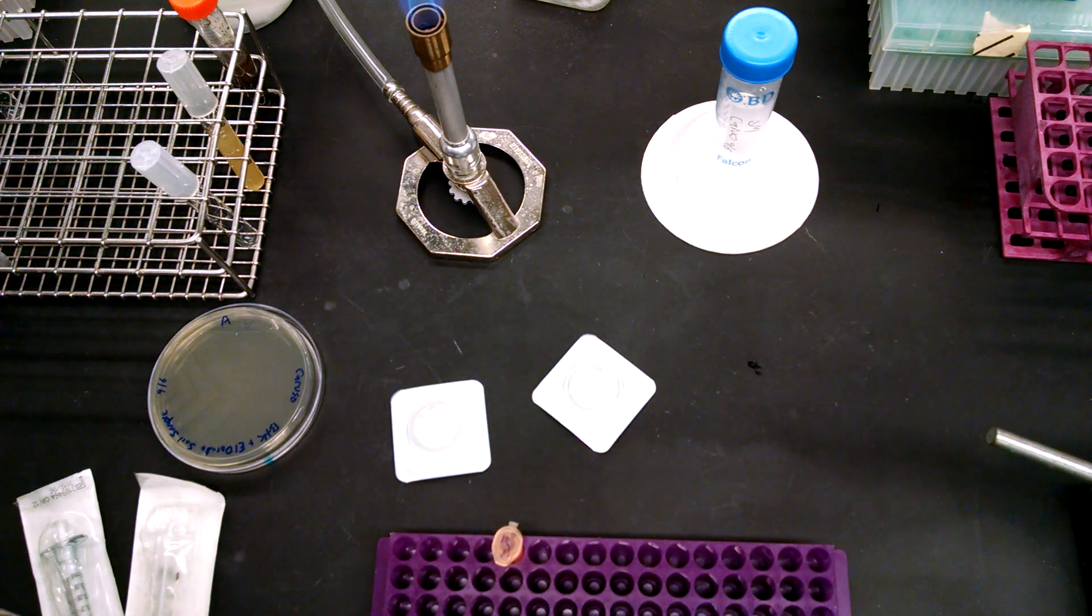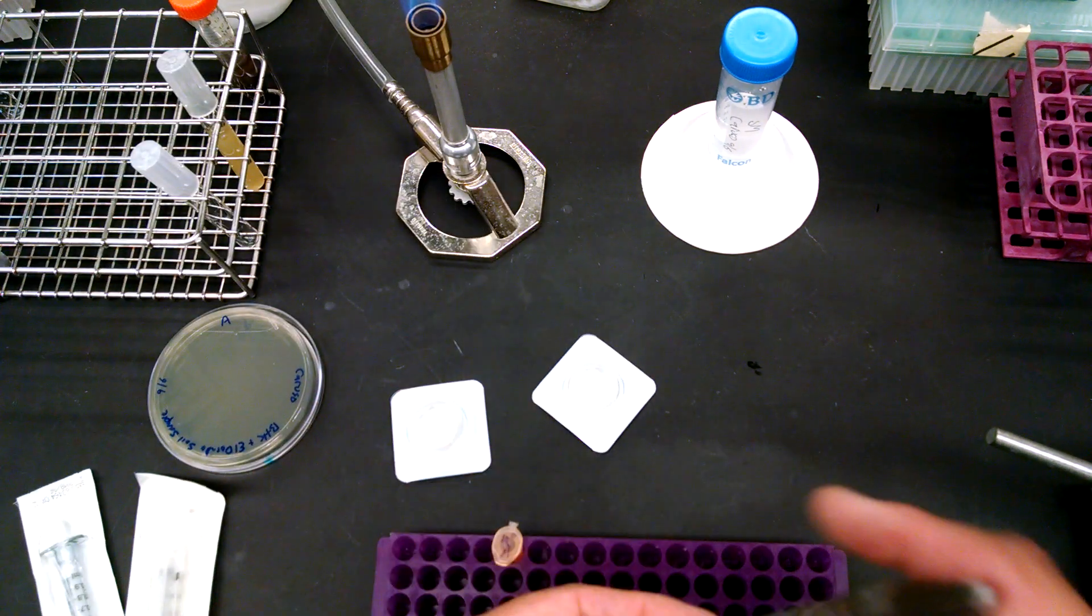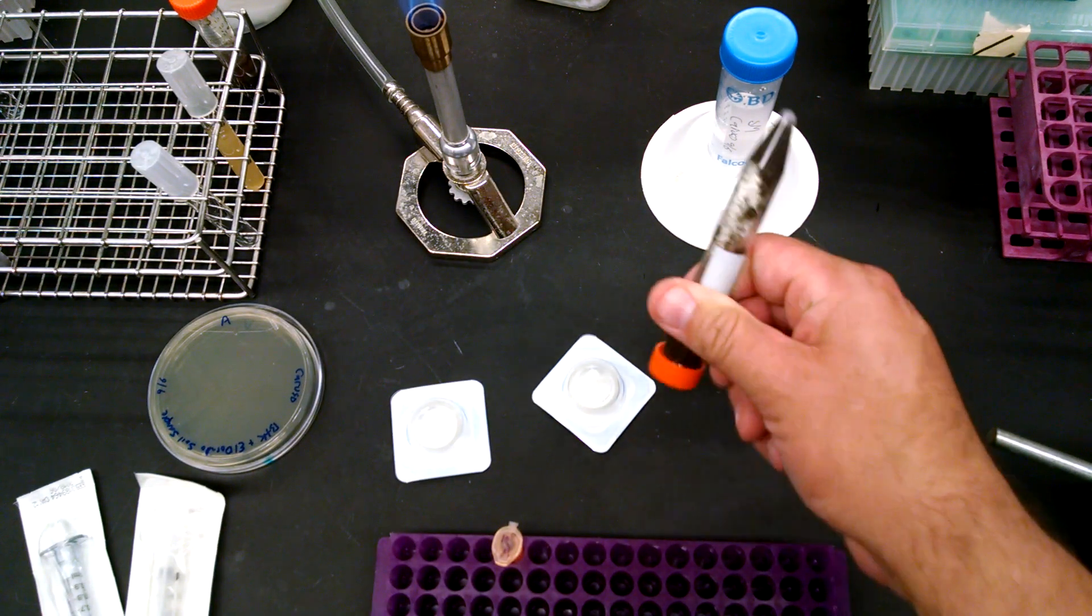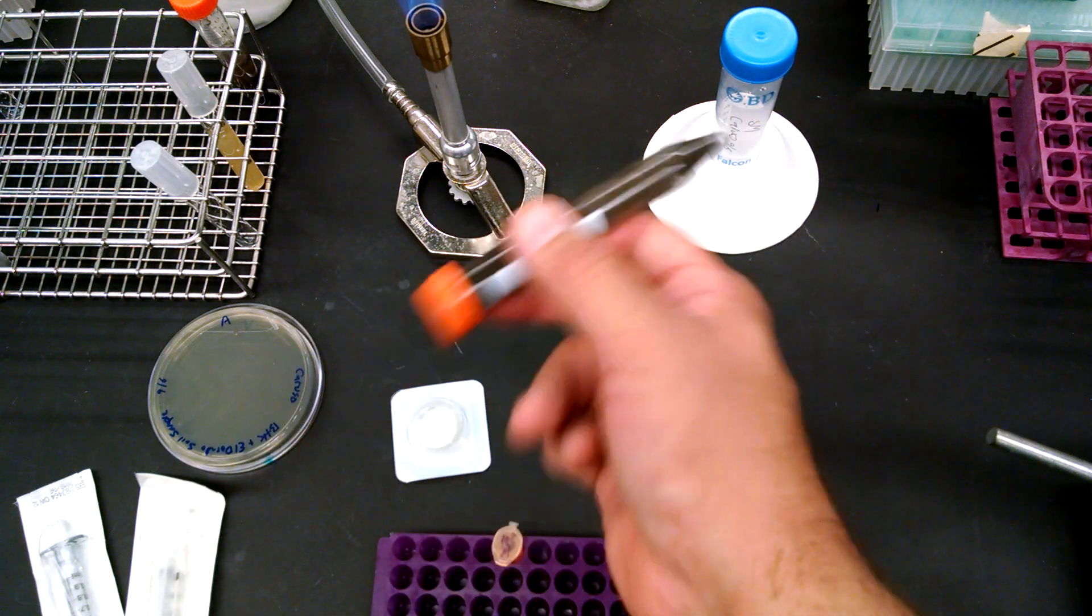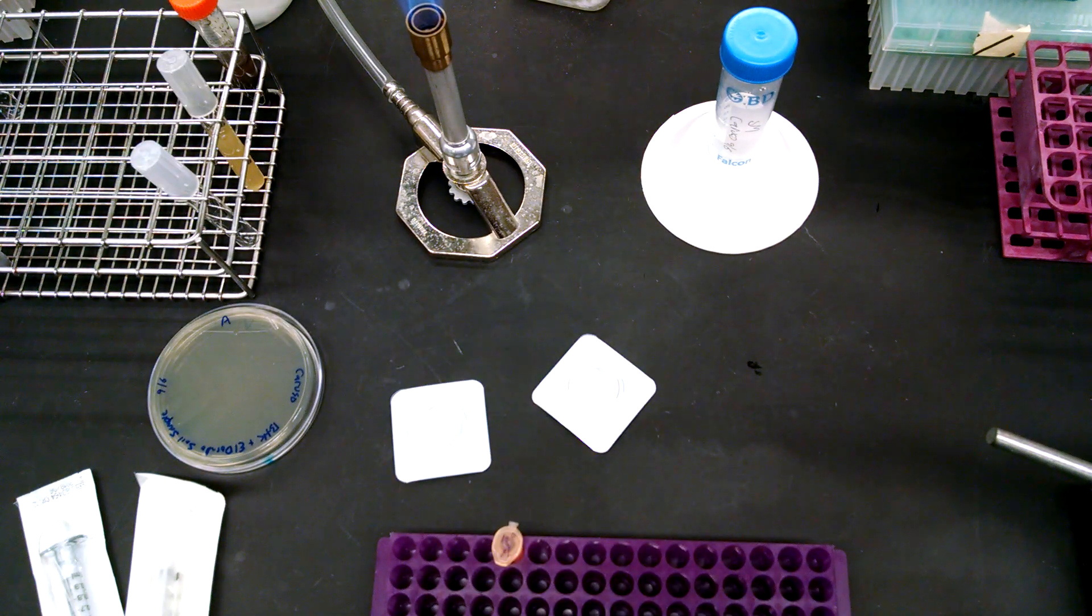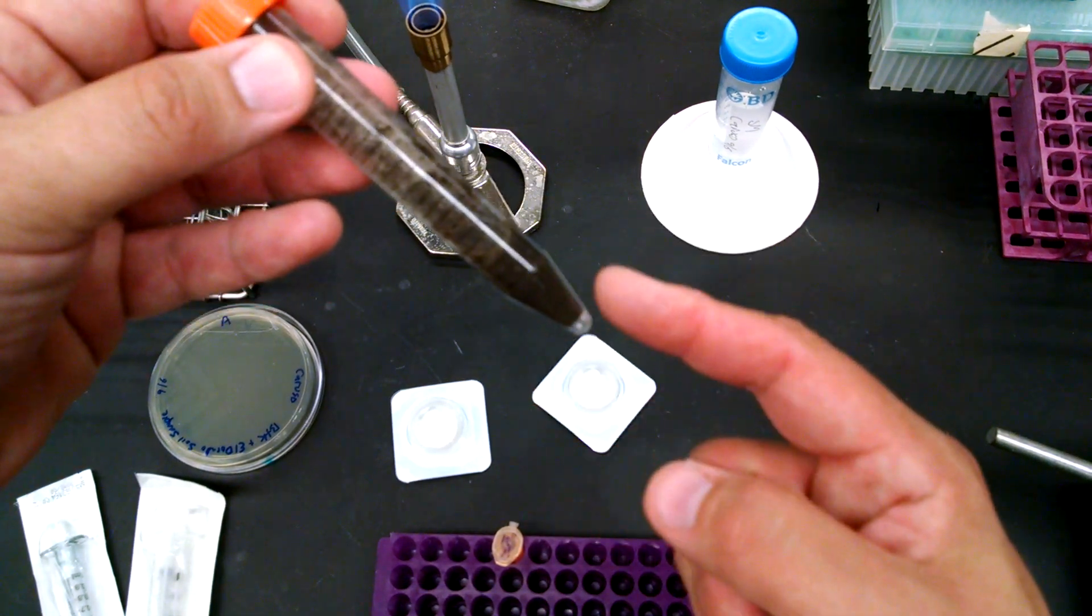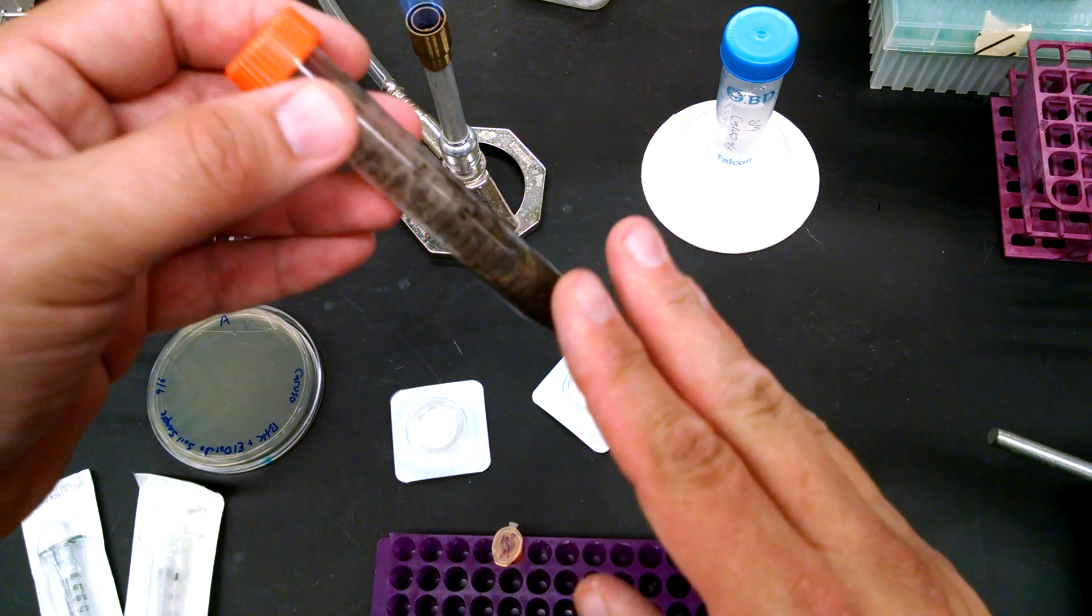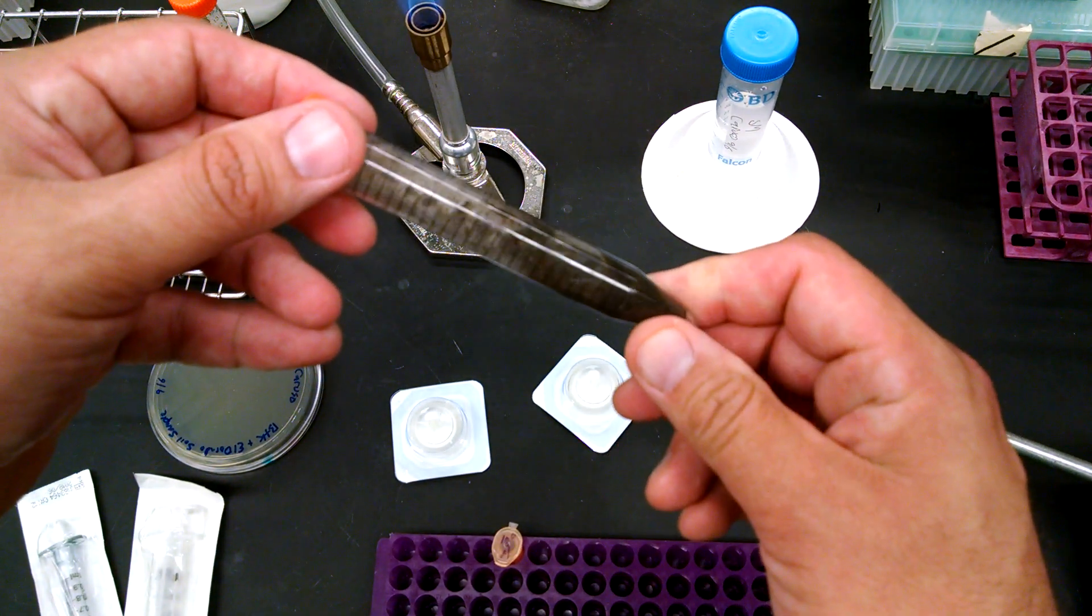You're going to take it and vortex it. You may have to be a little rough with them to make sure that all of the sample gets wet, and then you're going to let them sit for 20 minutes.